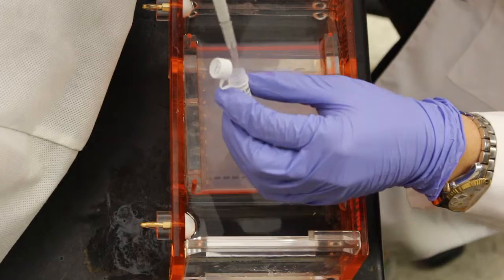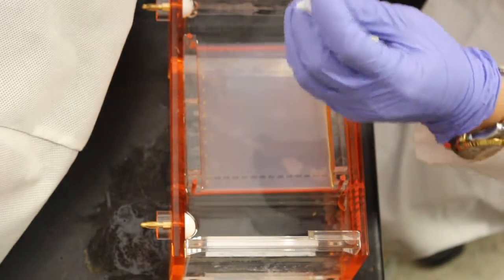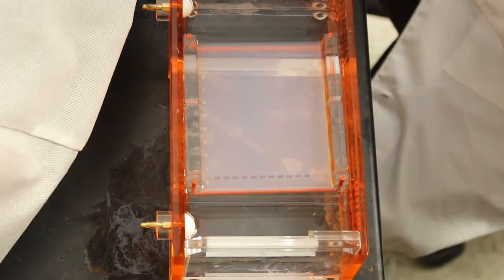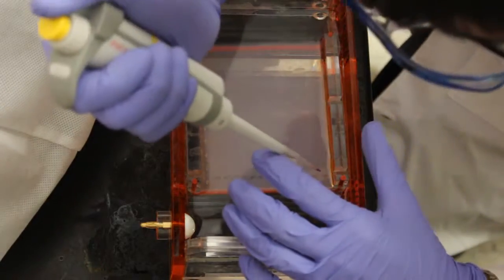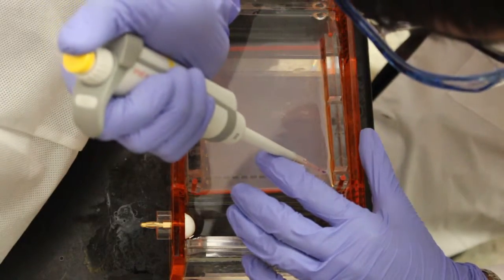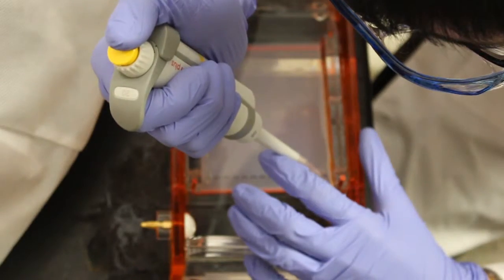Begin loading the gel. Molecular weight size markers contain standards of incrementally increasing molecular weight and can be used to approximate the size of different samples. Here we are adding a 1 kilobase and a 100 base pair DNA ladder.